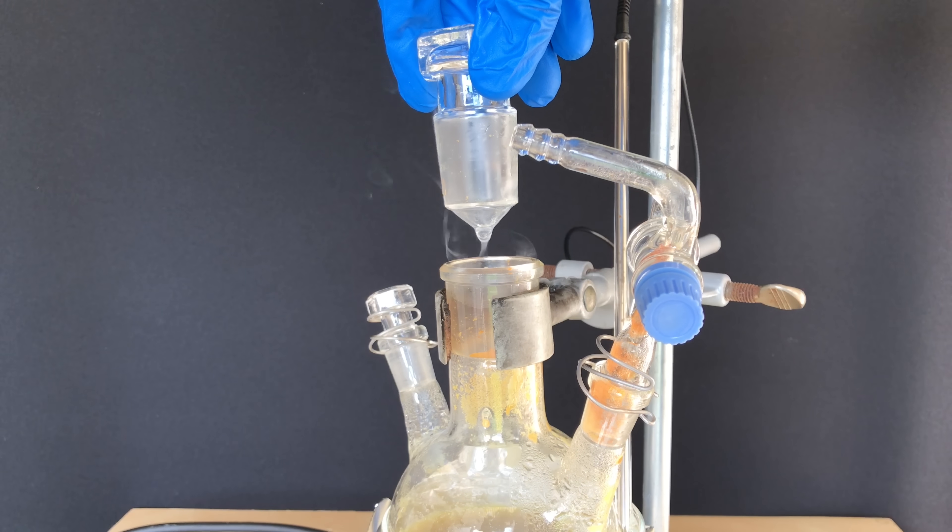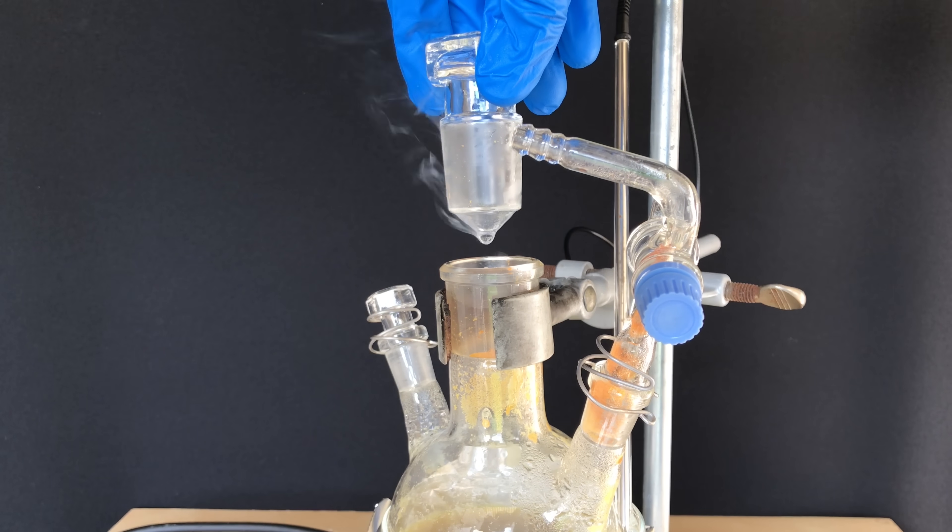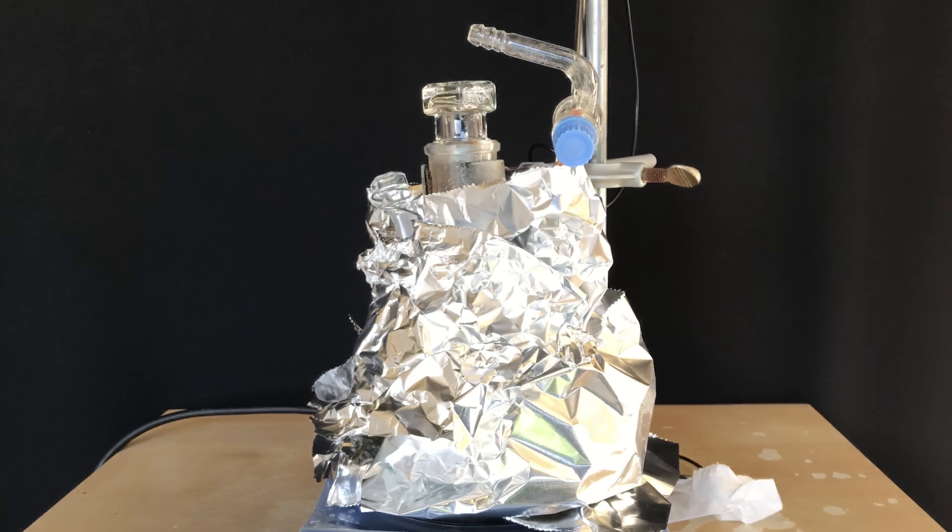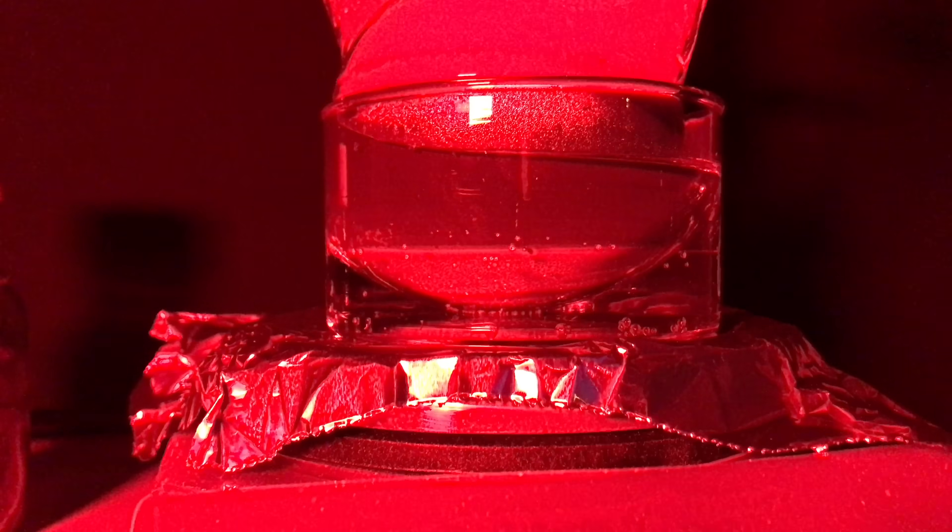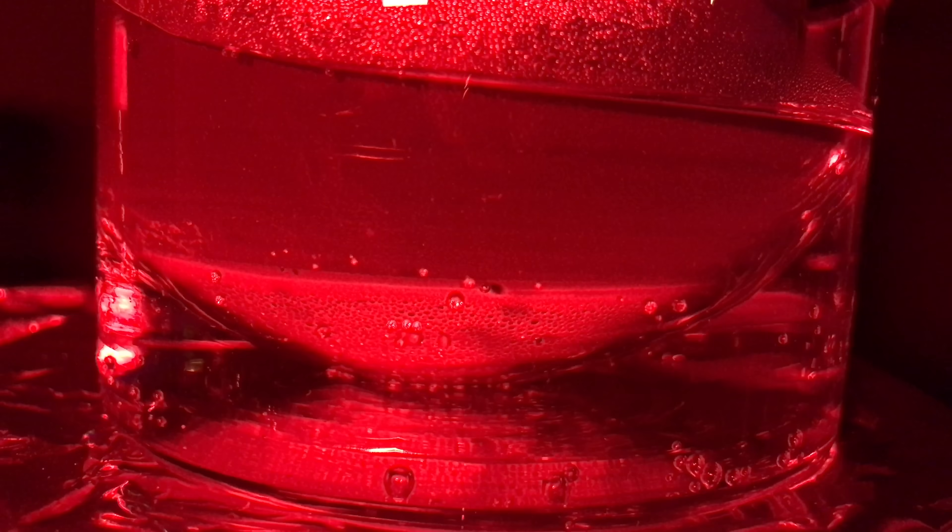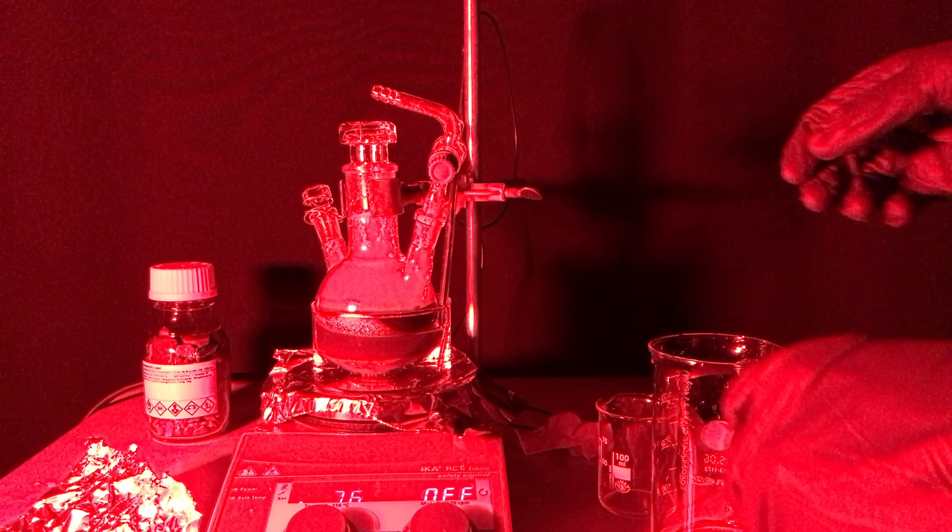I discovered that there was some white phosphorus on the stopper and decided to show it to you. When exposed to light, white phosphorus will slowly decompose back to red phosphorus and as we want really pure stuff, I wrapped the apparatus in aluminum foil. This was likely totally unnecessary, but after it got dark outside, I worked under red light because I thought it might be less harsh on the phosphorus.